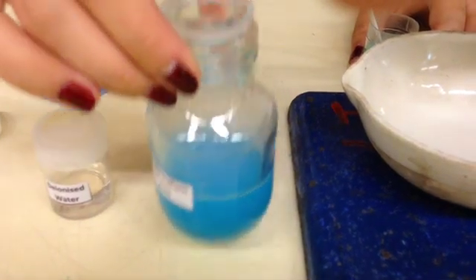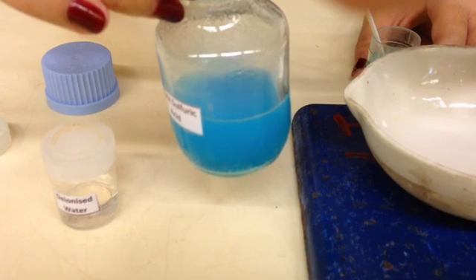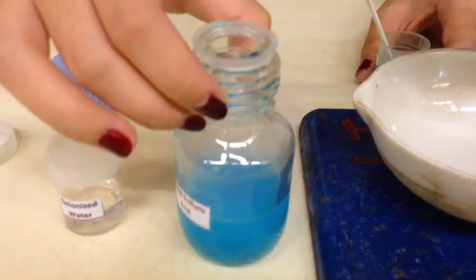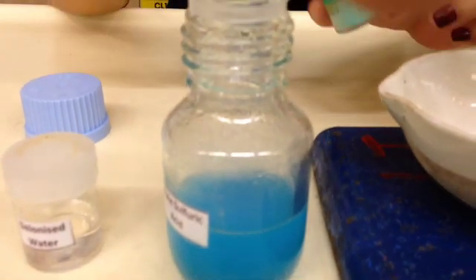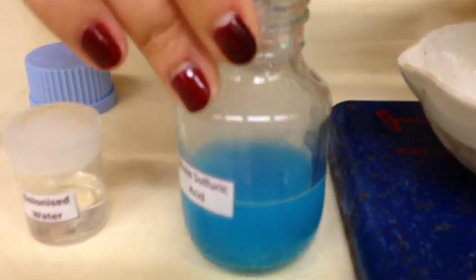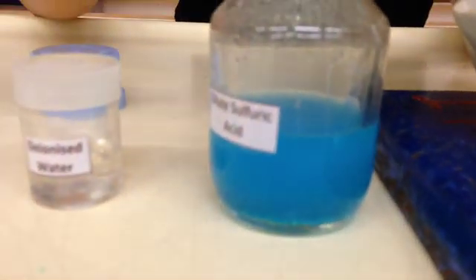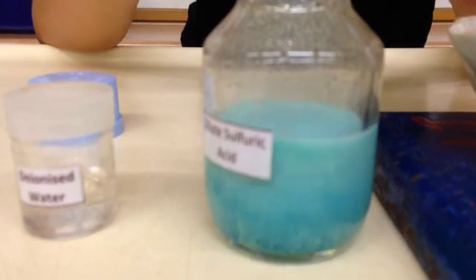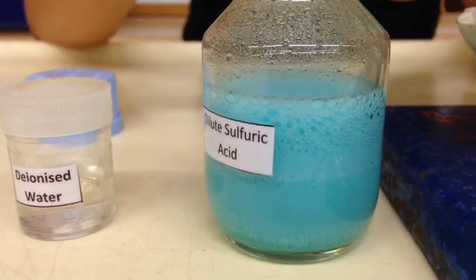Some of you may notice that the effervescence has stopped, and so you may think that the reaction has actually completed. However, remember that we need to add excess of the insoluble reactant. So if you don't see any excess of the insoluble reactant left inside, this means that the reaction actually has not completed yet. The bulk of the solution might still be sulfuric acid, so we need to keep adding. And as long as you see effervescence, it means that the reaction is not complete.